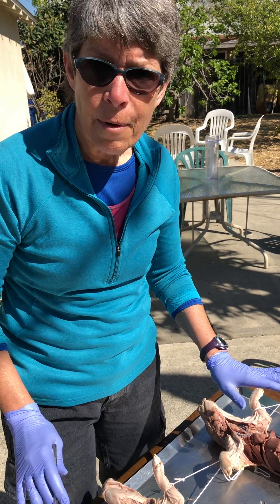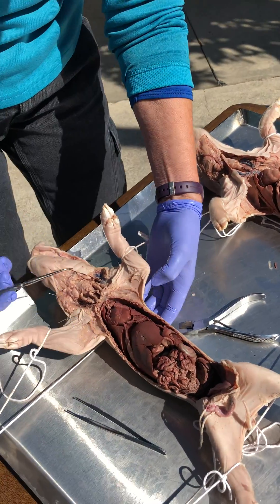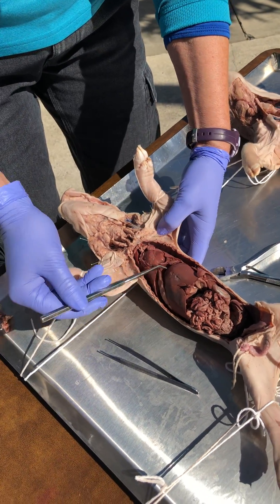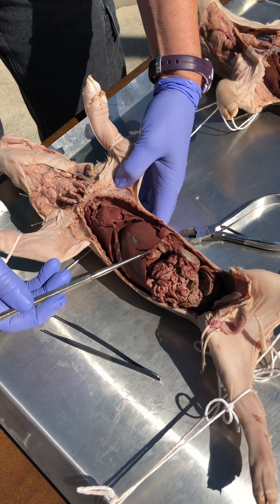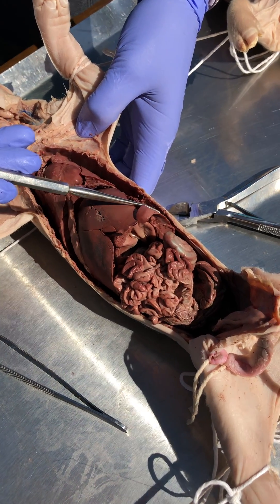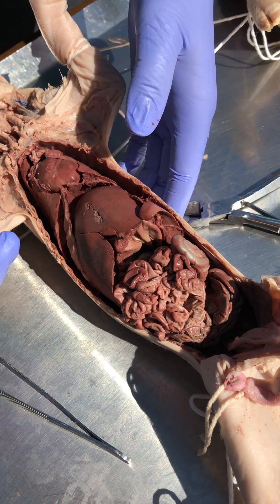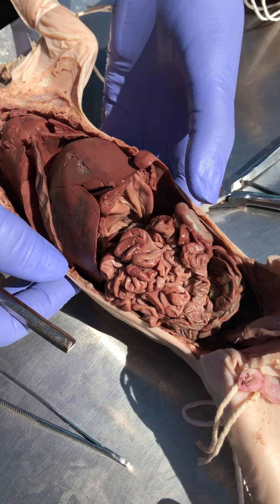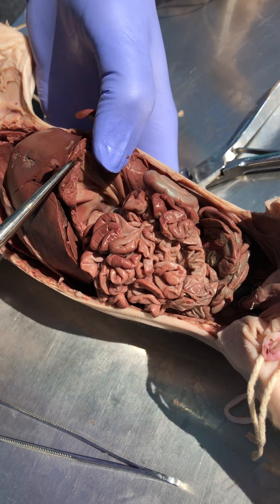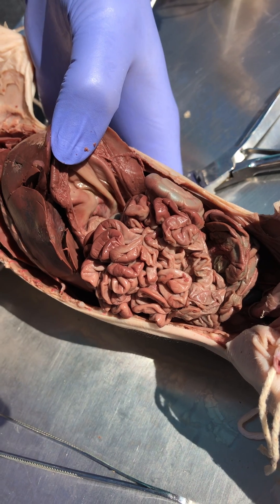So let's have a look at just the pancreas — okay, there it is. Just to get oriented: pig, diaphragm, liver, spleen — those are the superficial structures. To find the pancreas you've got to look for the stomach, and to find the stomach you go right posterior to the liver.